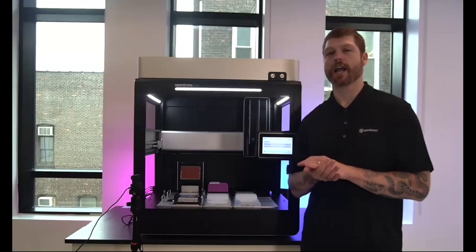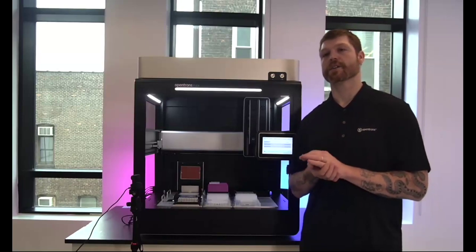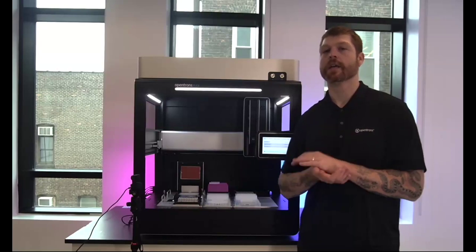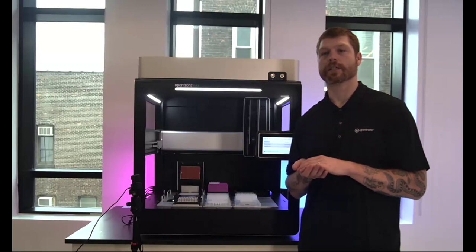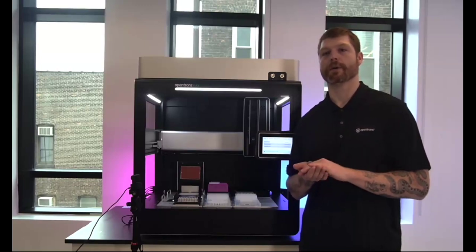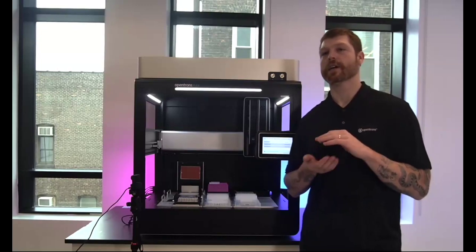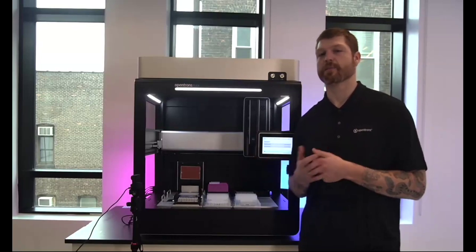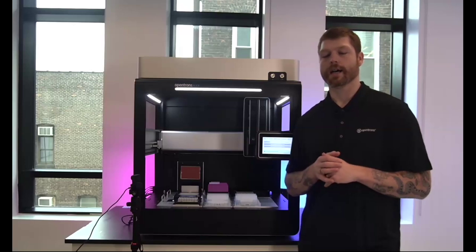One quick caveat on that is that there is a bound here. Depending on the labware and its definitions, as well as how well calibrated the instrument is, we have allowed some tolerance affordances. So there is an offset from the bottom, at which point we will say that no liquid was found. So very low volumes can be difficult to detect in tips based on how the meniscus is going to sit, as well as the bottom geometry of it.